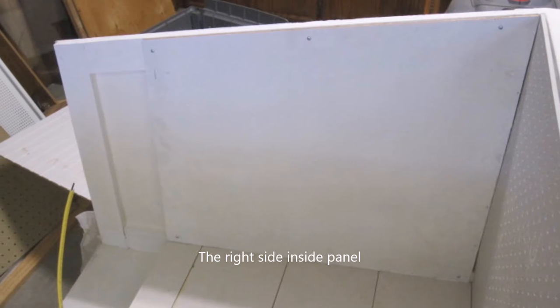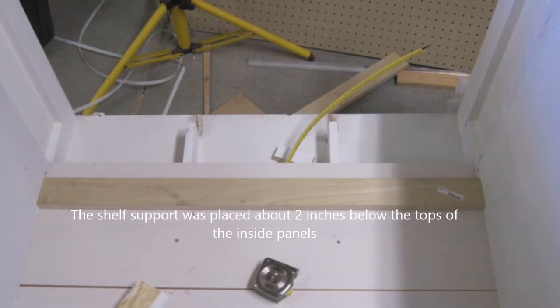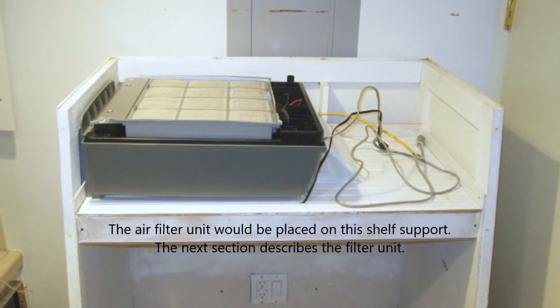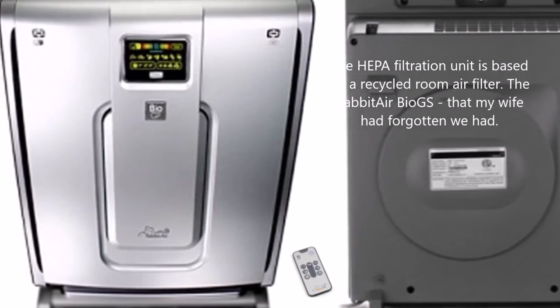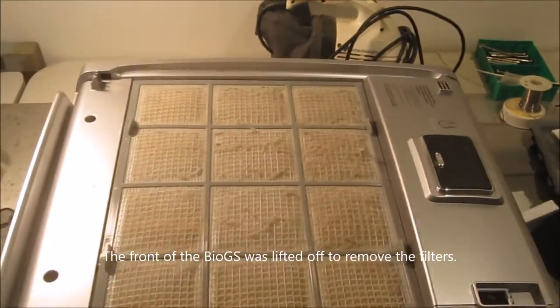You can see the left and right side panels. The fan filter was supported by a brown brace on top. I built essentially a rectangle — a shelf support on which the fan would sit. The bottom is an MDF piece on which the filtration unit sits. I harvested the filtration unit from something we had — my wife had forgotten we had it, so no complaints there.